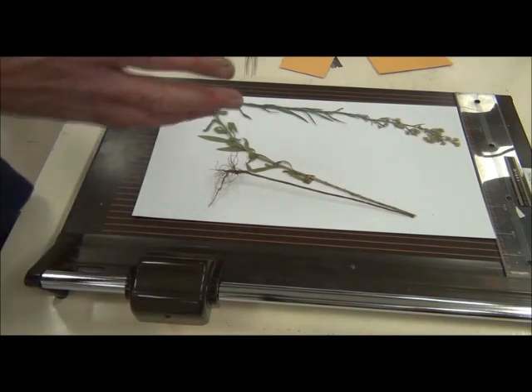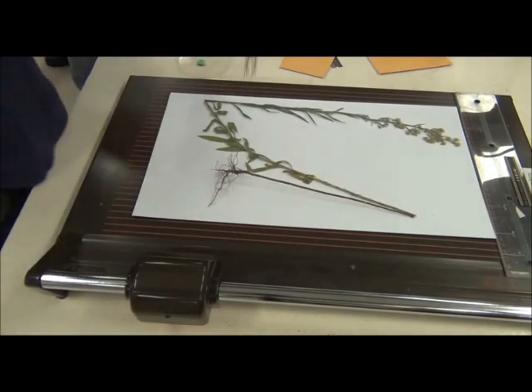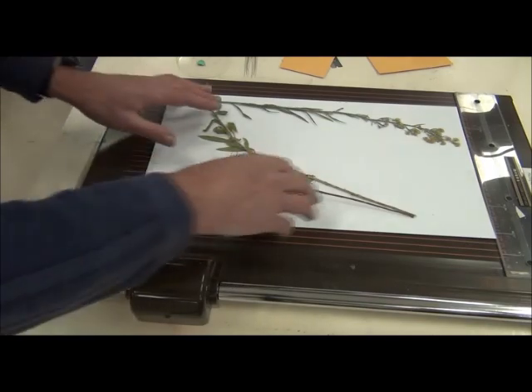So even less than that is okay but don't have it over the edge. There's no point because the specimen will just be damaged.